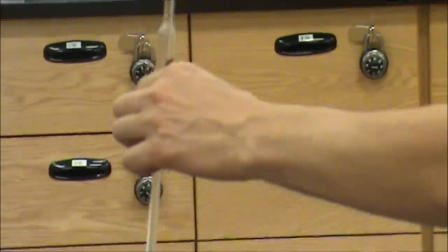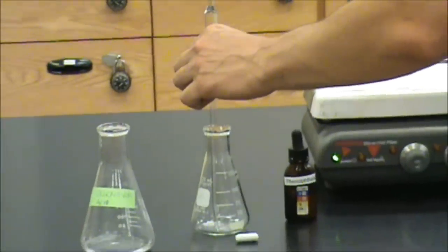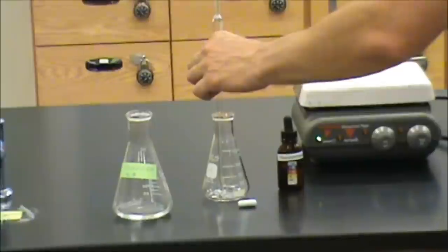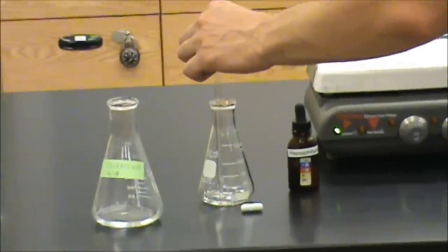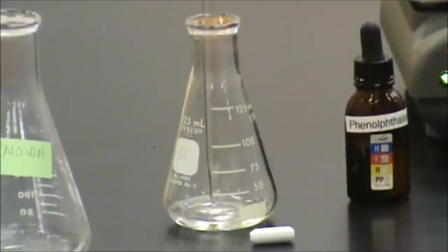We're now going to transfer this fluid to our Erlenmeyer and push down on the top of the pump to add it carefully.